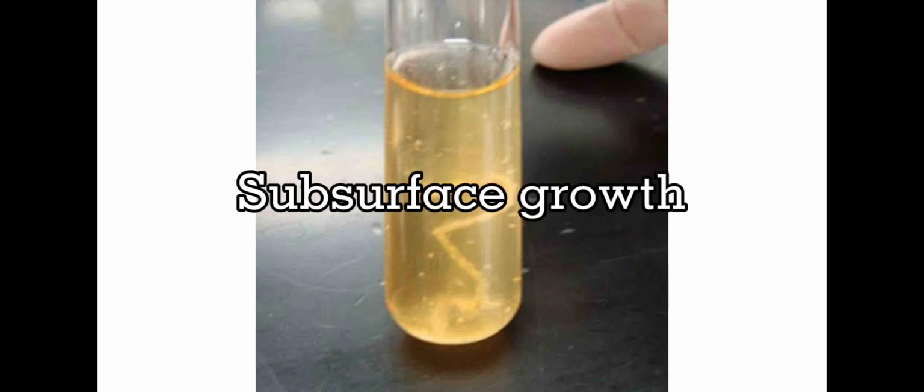Some bacteria form clusters of growth that are either floating in the broth or stuck to the sides of the tube at every level. From top to bottom, these bacteria correlate with facultative anaerobes. Membranous: thin, coherent growth like a membrane. Subsurface growth.